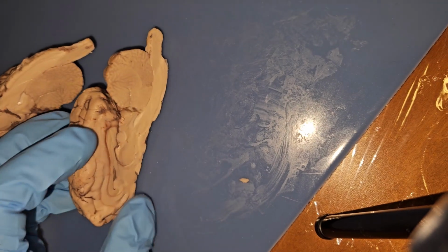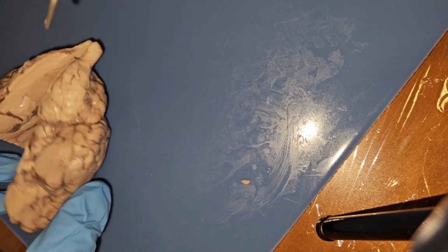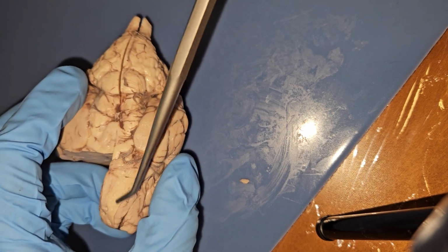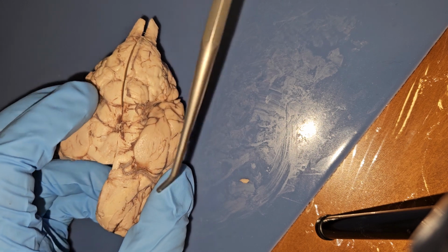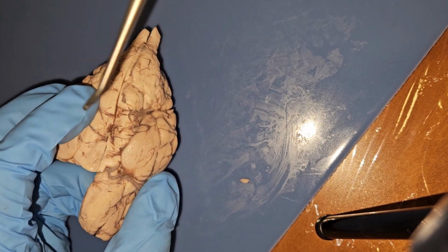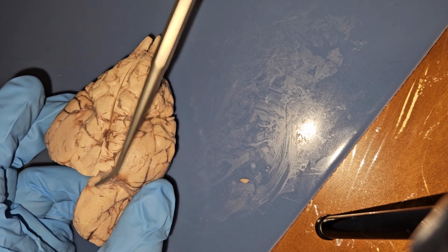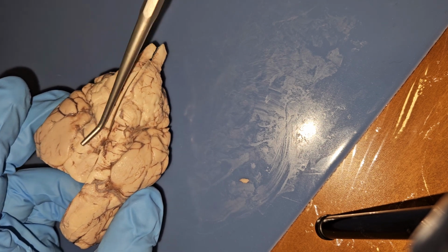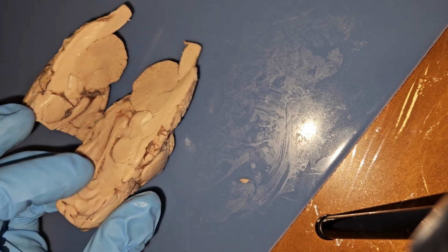Then down at the bottom, it's obviously cut in half already, but we have the olfactory nerve bulb and tract. They said the cranial nerves are already all taken out. But then we have our optic chiasma that crosses over here, which our pituitary gland would be sitting dangling down right here, but it was also removed.